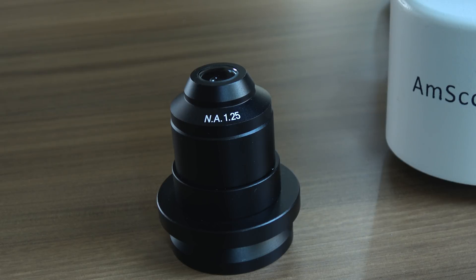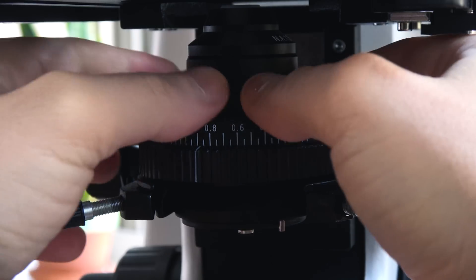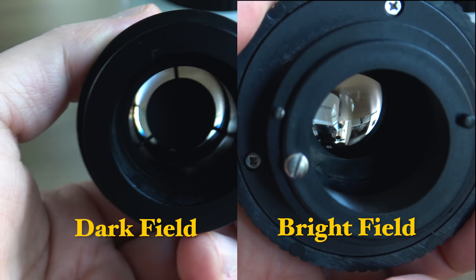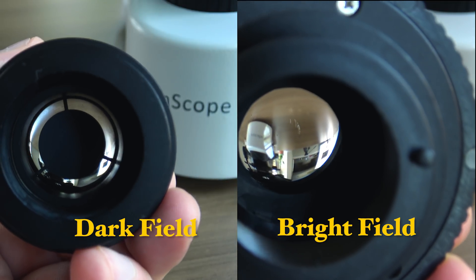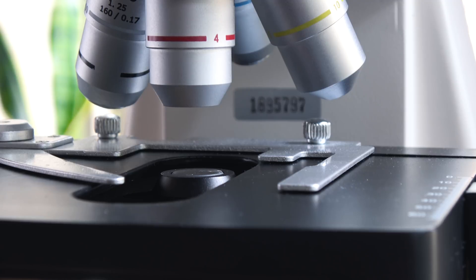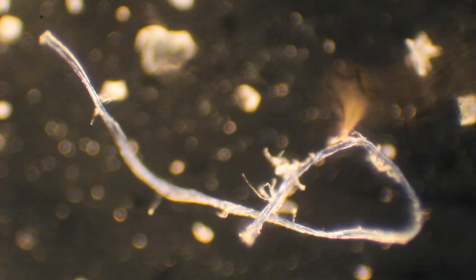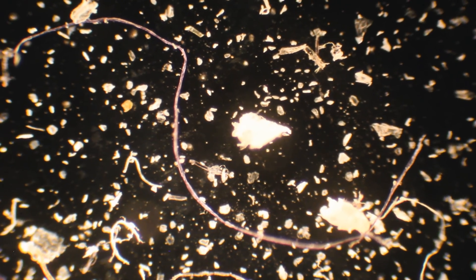The dark-field condenser has arrived. You can see here how the dark-field condenser operates — the light is blocked by a plate and can only enter from the slits on the edges of the condenser. Let's see if the dark-field condenser creates a difference. Only a deep-sea explorer can understand the excitement you have when you look at the images produced by the dark-field condenser.